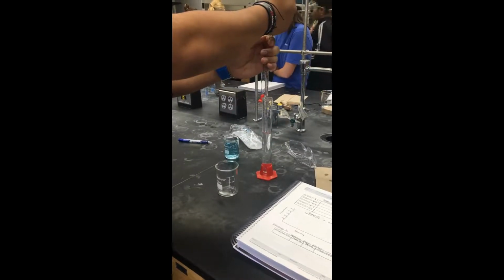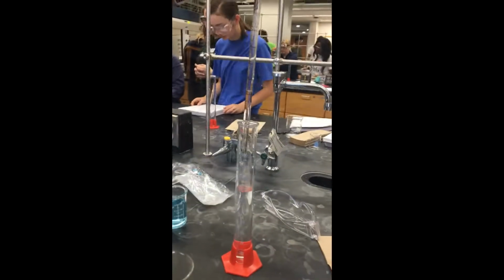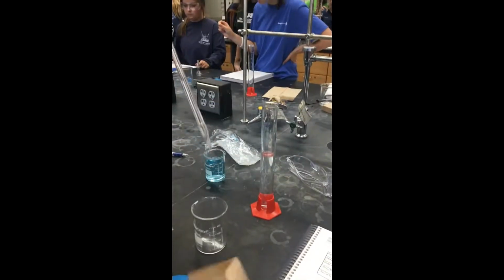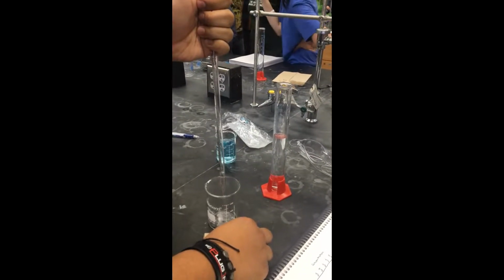In order to relate concentration and density, we are finding the density of 5 milliliters of the given 20% concentrated stock solution. A stock solution is a concentrated solution that will be diluted to a lower concentration. Here, Franz is measuring the 5 milliliters of stock solution.